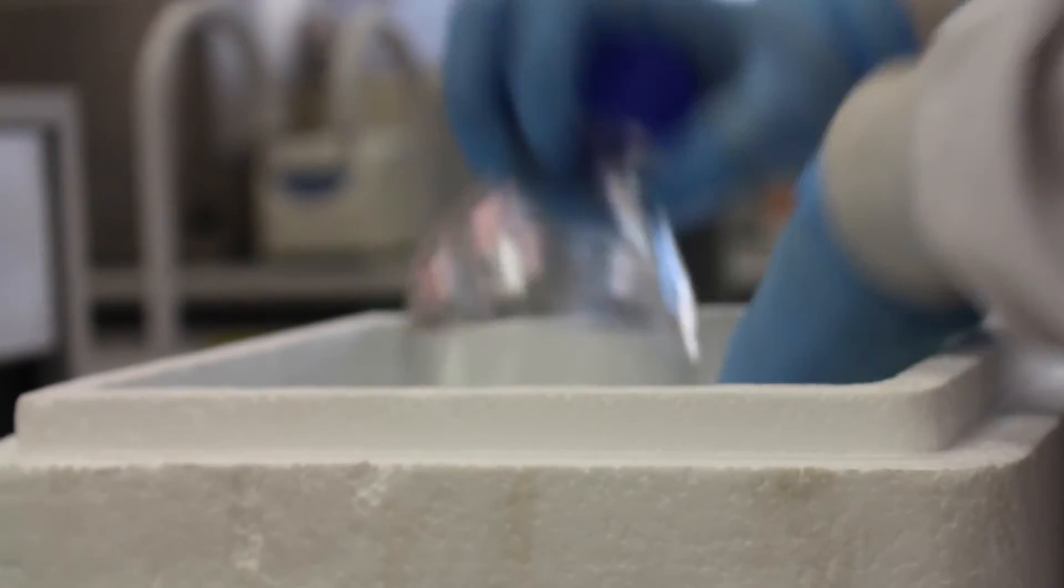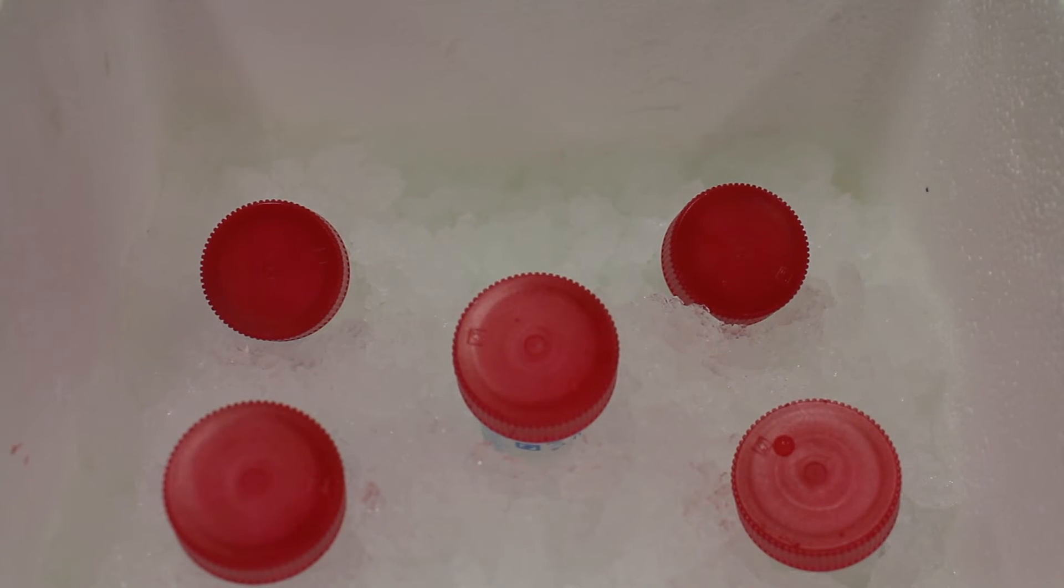The buffer is then stored on ice. For the next part, falcon tubes are pre-chilled on ice.